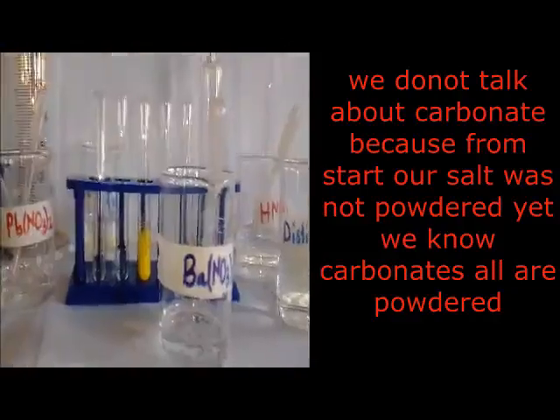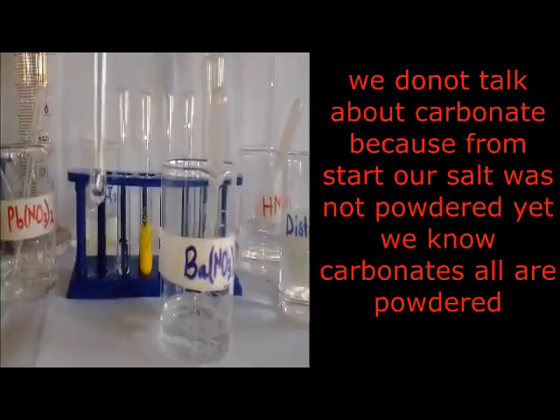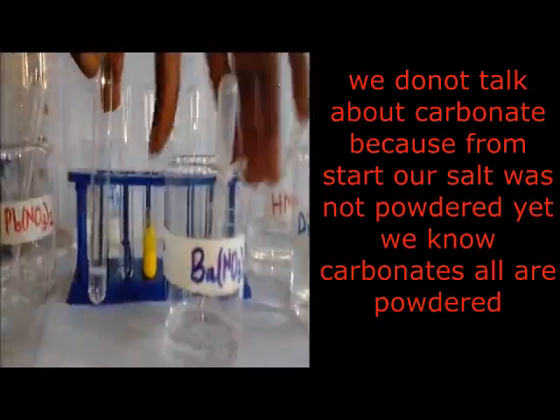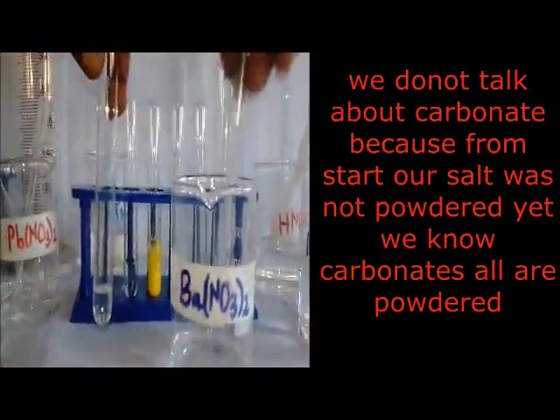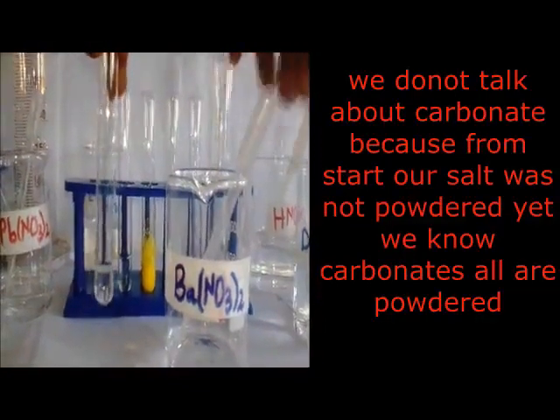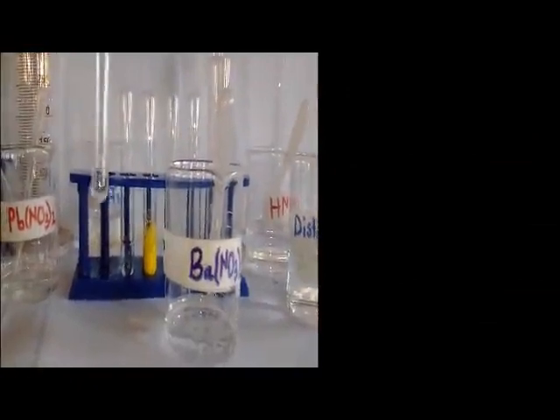At this point, we are adding lead nitrate, which is about to show us sulfate and chloride. Lead nitrate is showing it is not there. If it was there, it would change to a white precipitate. So now we say sulfate and chloride are absent. Then we say nitrates are present.